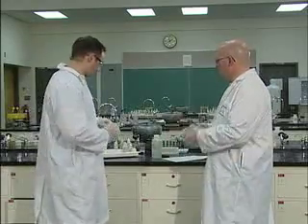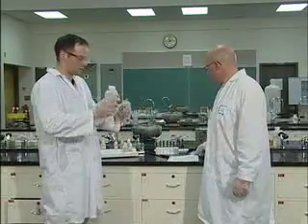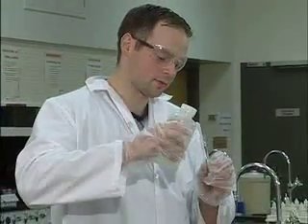Okay, good. Well, let's do our composition one. So for composition, you're going to add distilled water. Notice how I've labeled this test tube A. You might want to label your test tubes the same way. It doesn't matter though. You're going to go through this step by step. Good idea to have a table done beforehand, class. Do they have one in here? They do actually.